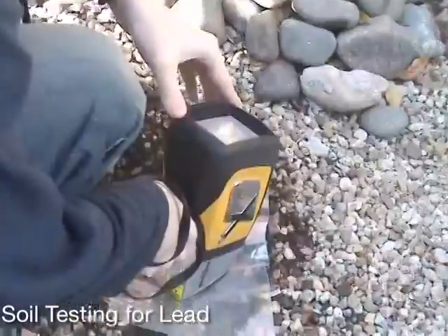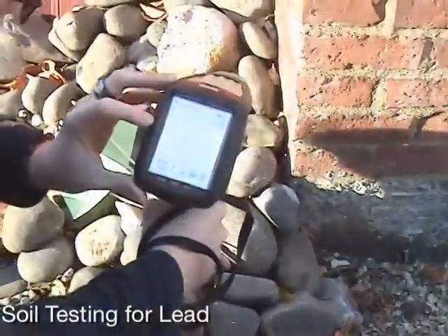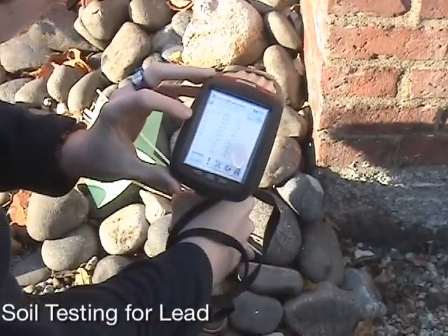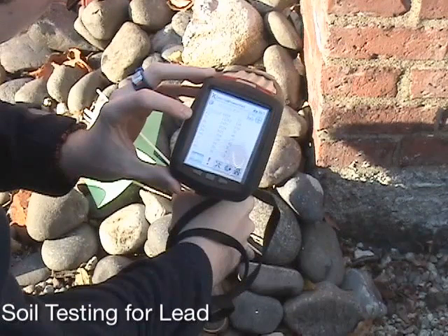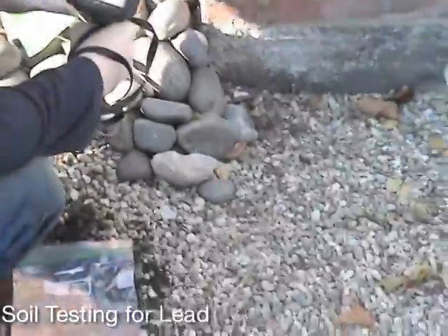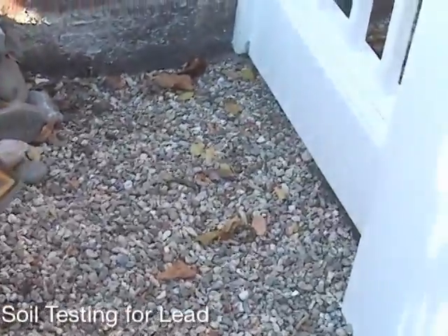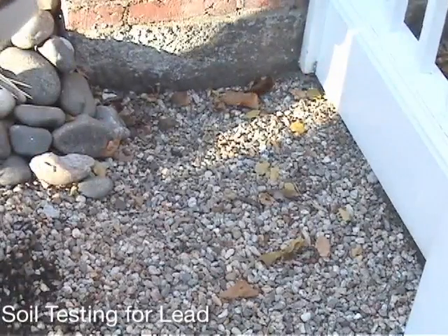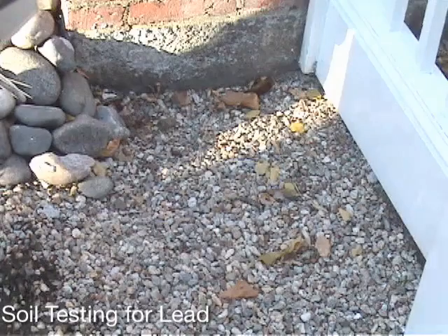The readings of the drip line soil are about 2,300 parts per million lead. As a reference, the US EPA gives a general level of 400 parts per million lead in a residential area. The owners have covered the drip line soil with stone, which helps prevent access, and although there are no children living here and no edible plants growing, the owners may want to remediate further at some point in time.